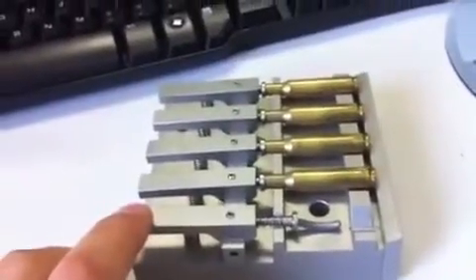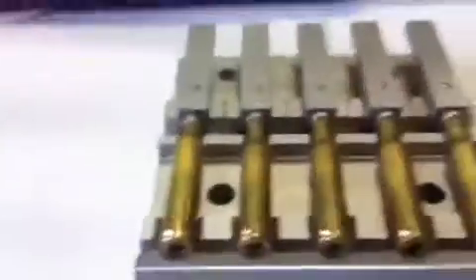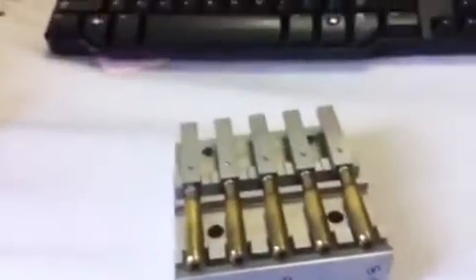You can quickly and easily insert the bullet shell — it's very difficult to do with one hand — but the idea is that you can quickly and easily mount each bullet shell into this five-bullet-shell fixture, mount the fixture on the stage, and just go ahead using coordinates to quickly load five bullet shells, find one starting location, and you're off and running. The software will take care of the rest and you'll have all your data.